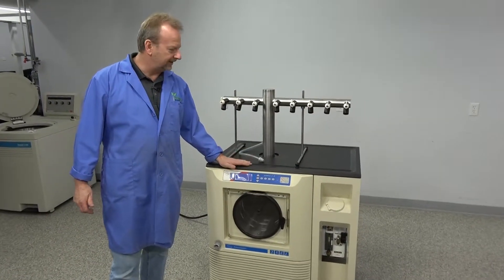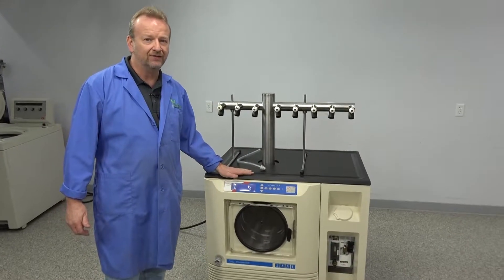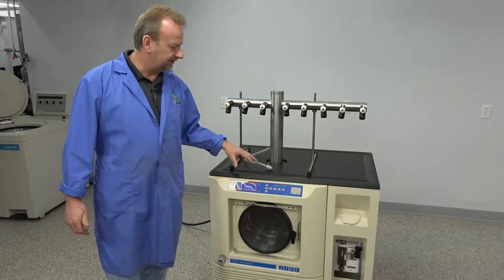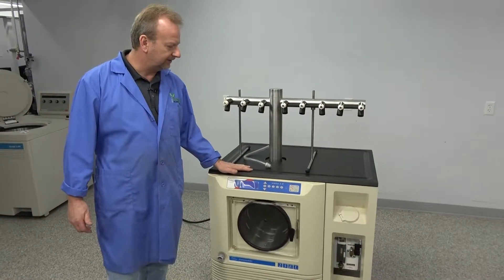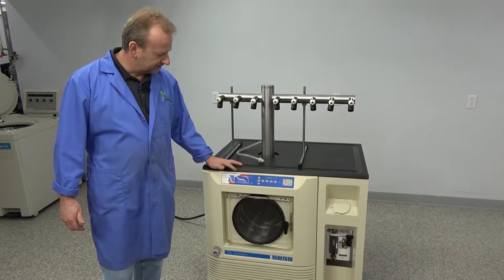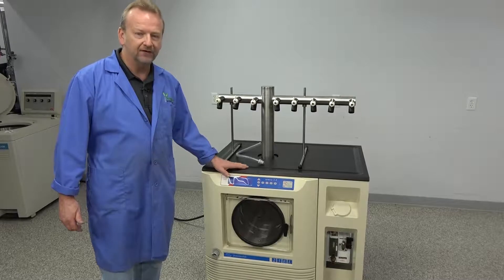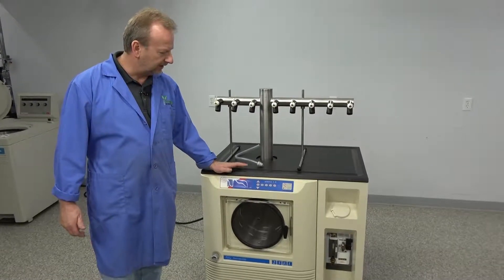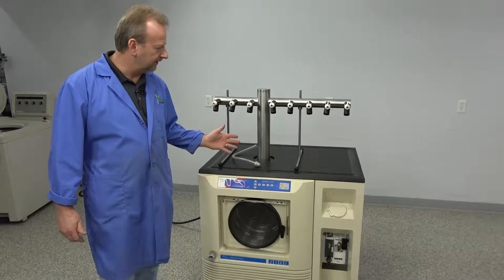This unit is really nice, probably one of the nicest units I've had in here so far. It's not the newest, but it's definitely the best running one I've seen. Our temperatures are well exceeding the manufacturer specs on this, but I do want to point out some of the things that we've done on it.